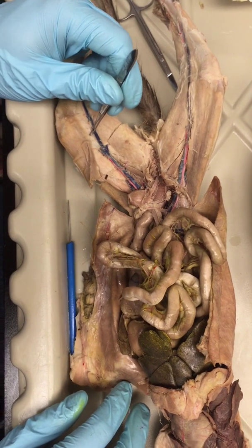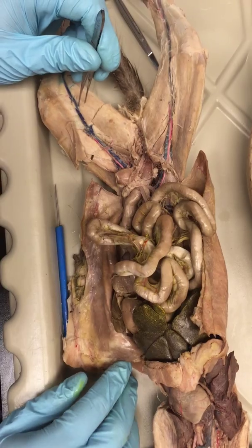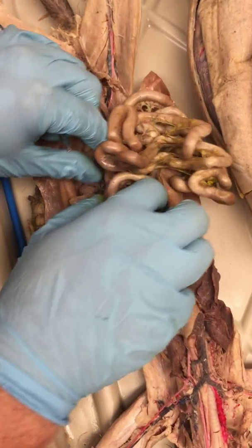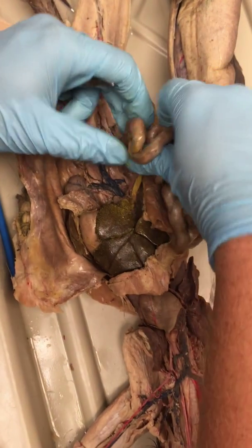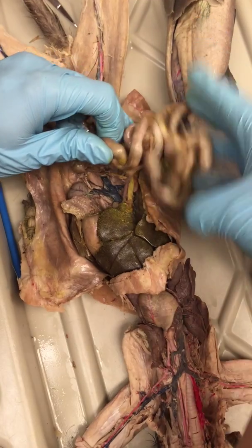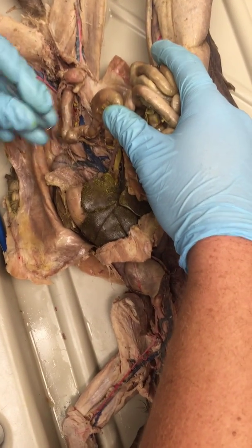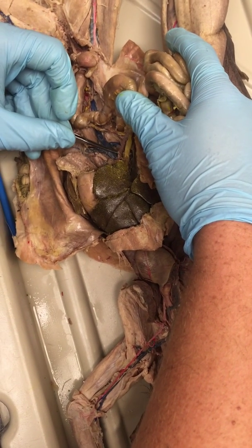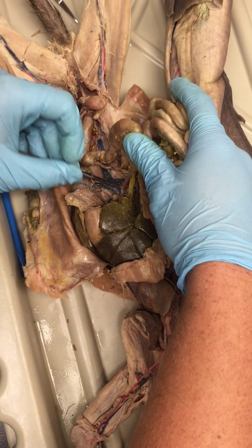Okay, now, this is the hard part, because the intestines are kind of wiggy, and it's really hard. They're all over the place, and they go everywhere, and it's really hard to deal with them. But I'm going to do this as well as I can so that you guys can see what we're doing. So we have to separate this into the small intestine and large intestine, because there's different arteries and veins that go to either one. But starting off, we're going to do the arteries first, and the artery that comes off the abdominal aorta is the superior mesenteric.